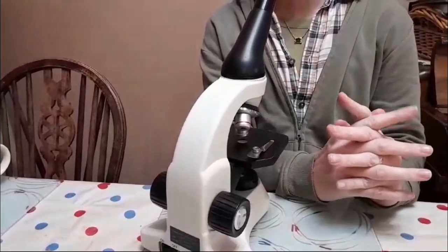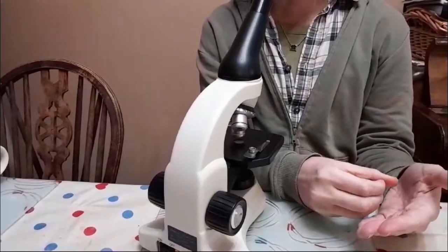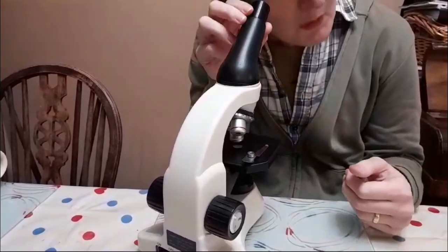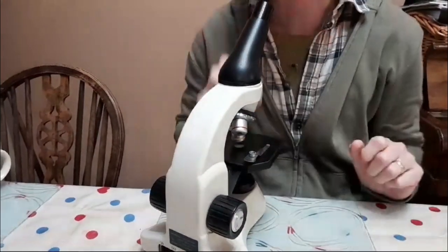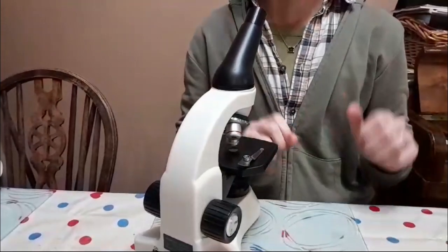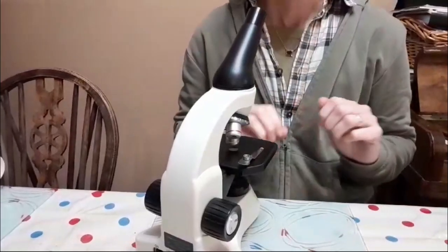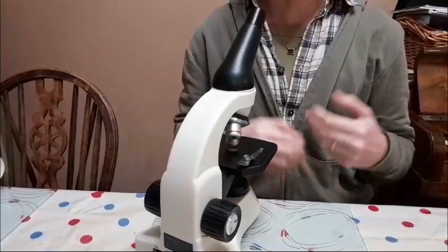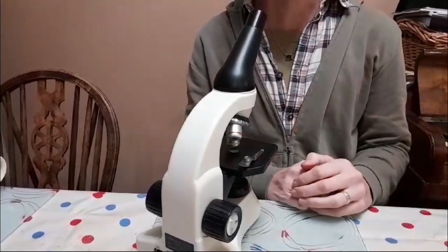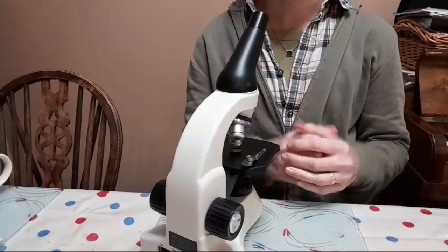In the exams, you're usually asked about something about magnification. Okay, so at the moment I've got times 100. That's quite easy. So I'm looking down here, I'm drawing my cells and I'm measuring them with a ruler, and I say, right, okay, so it looks like when I do all my measurements here, each cell is about 2 millimeters in size. Fabulous. Hang on a minute, 2 millimeters in size, that's quite big. I'd be able to see that.